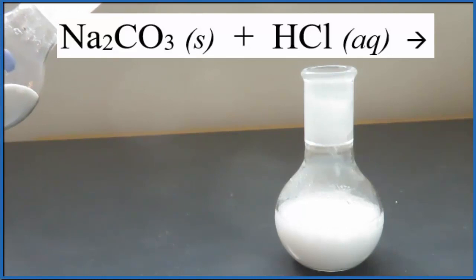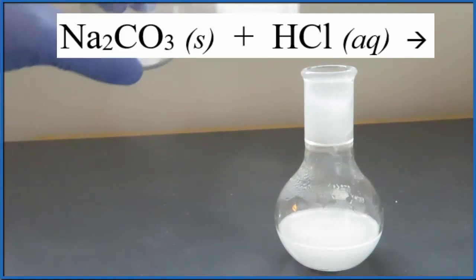Right away we see that we get the bubbles. And bubbling, that's a sign of a chemical reaction, so we're pretty sure there's a chemical reaction going on. And we do see kind of a white mist, that might be the water vapor, might just be water splashing out.